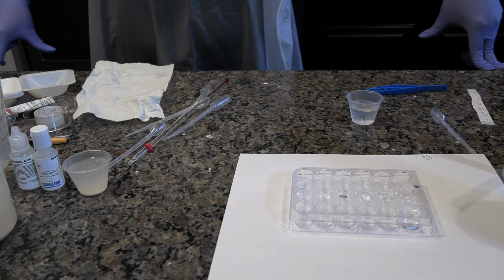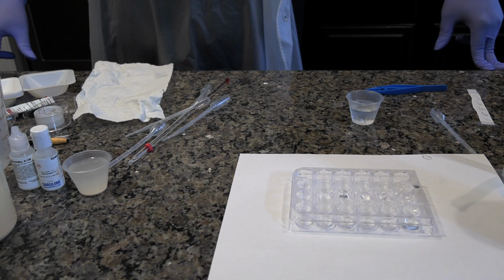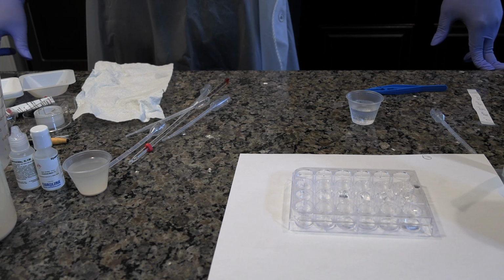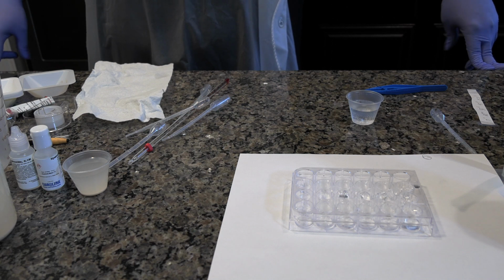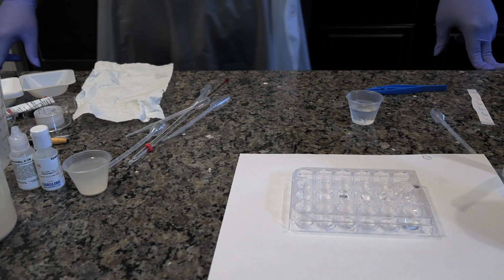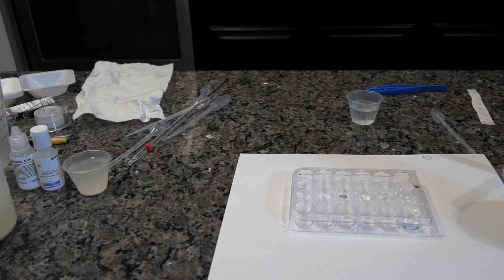Disposal and cleanup. There are no toxic materials produced during this activity. All solutions can be rinsed in the sink. Wipe up any hydrogen peroxide spills, as they could bleach colored fabrics, countertops, and clothing. Excess hydrochloric acid, hydrogen peroxide, and sodium hydroxide can be rinsed down the sink. Empty hydrochloric acid, hydrogen peroxide, and sodium hydroxide bottles can be disposed of in the trash.